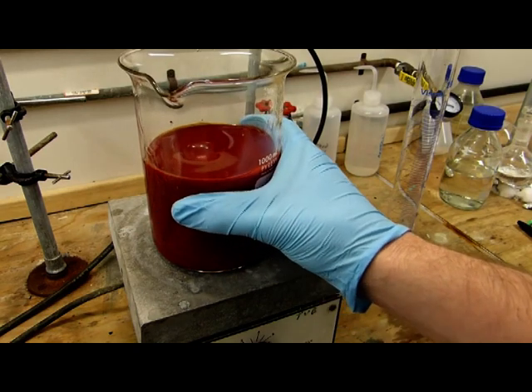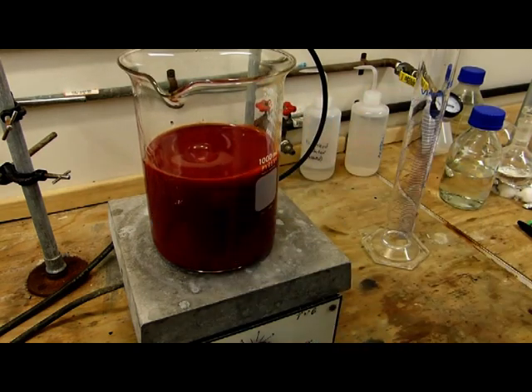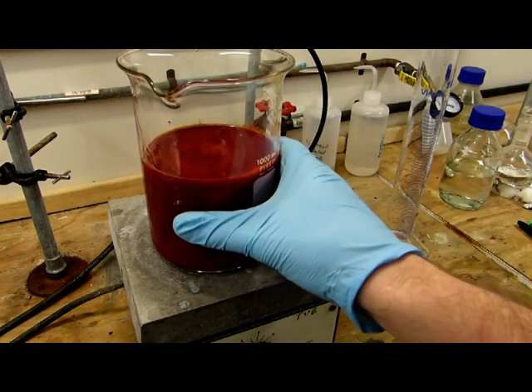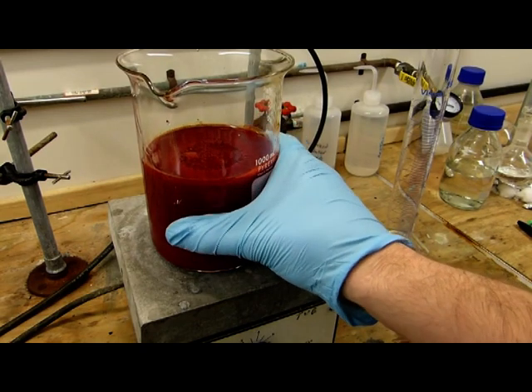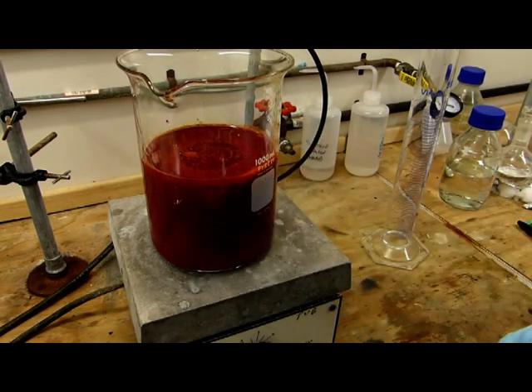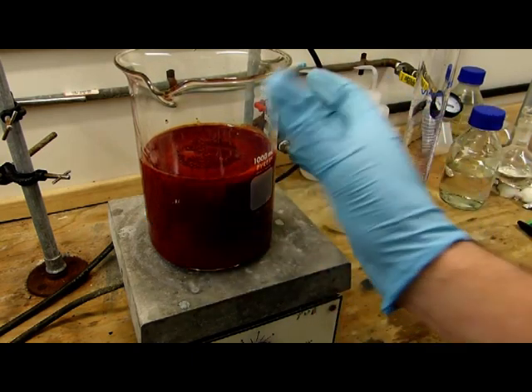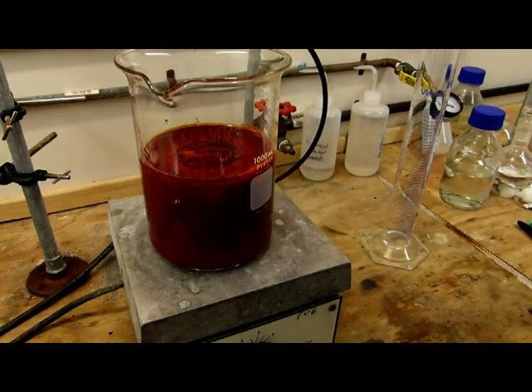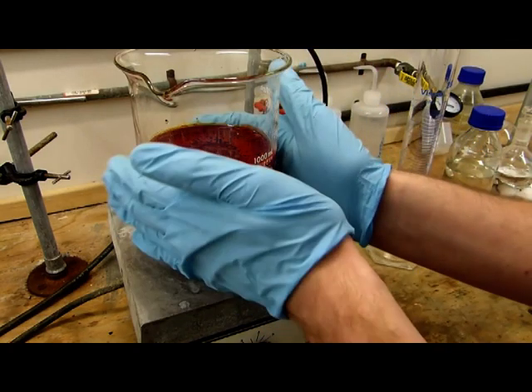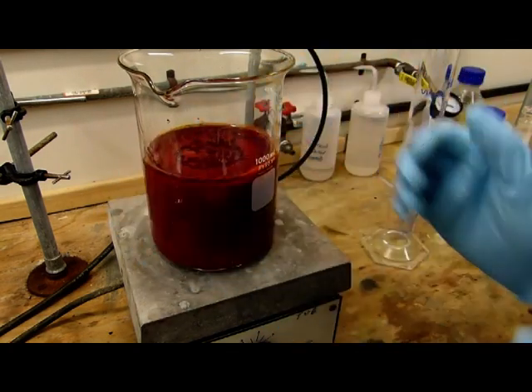Now that it's all relatively stirred together and it's also quite hot, I'm going to turn off the stirring and we'll allow it to slowly cool to room temperature to precipitate as much chromium trioxide as possible and also increase the size of those crystals, which you can see now are quite abundant, before we move on to the next step which is of course filtration.